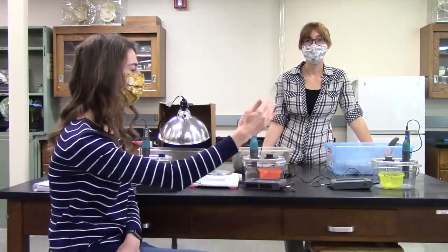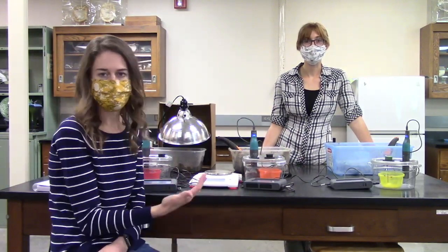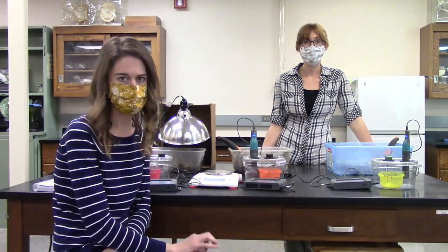So we have 3 CO2 sensors set up on the table before you, and we also have 3 soil samples. Dr. Robbins will be going through all of this in the lecture PowerPoint and in that lecture video, so I would suggest watching those first. We just wanted to show you a demonstration because this is probably equipment that, if you didn't take Bio 1 at UNO, you maybe have never seen before, or maybe you used it one time, but it's just good to have a little refresher on what the CO2 sensors are and what we're actually doing for this lab today.